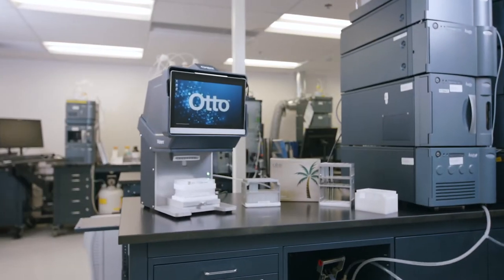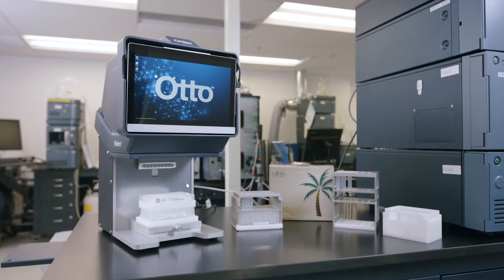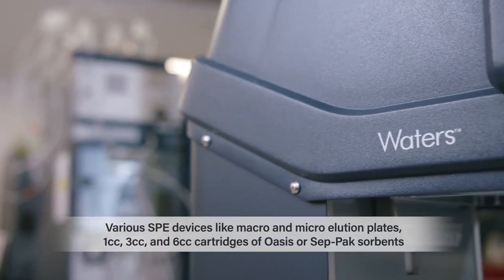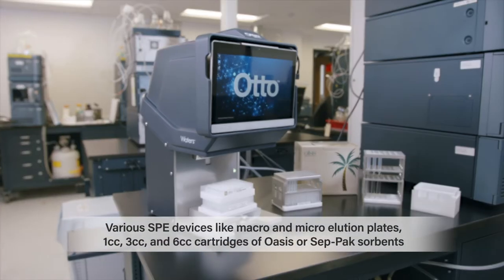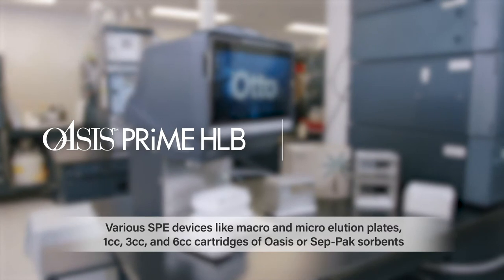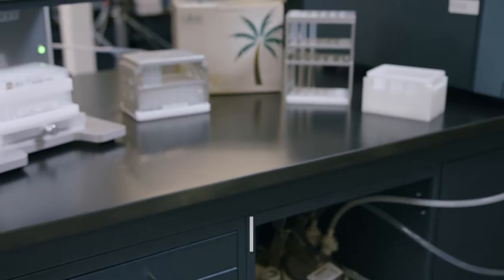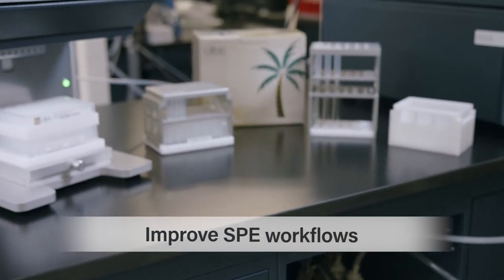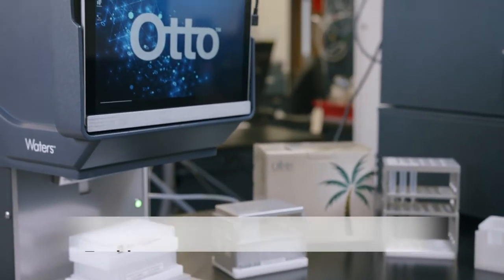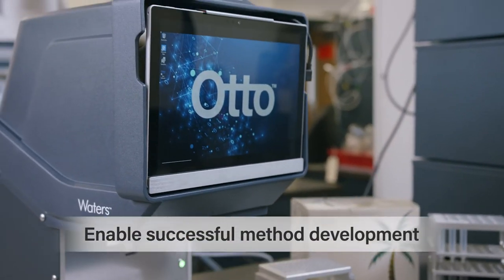Introducing Waters' new Otto Specialist positive pressure manifold, used for processing various formats of SPE devices like Oasis HLB Prime and Sep-Pak cartridges. Otto Specialist can improve SPE workflows, remove user variability, and enable successful method development.